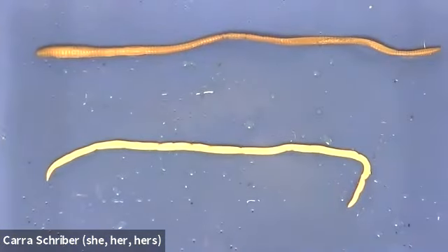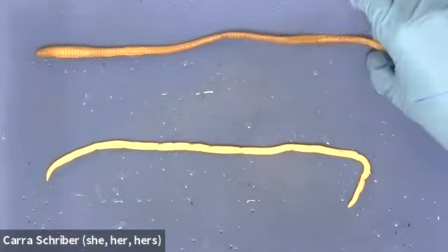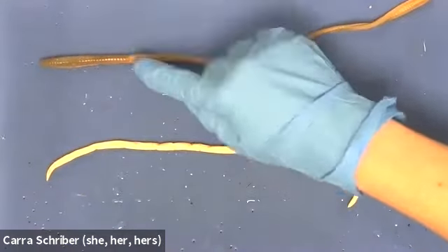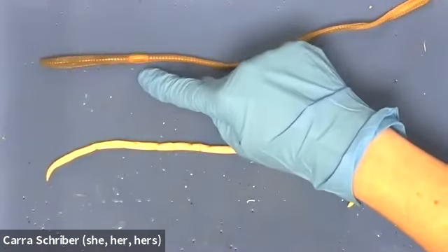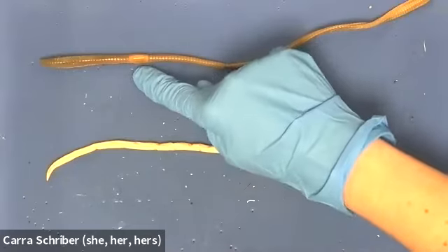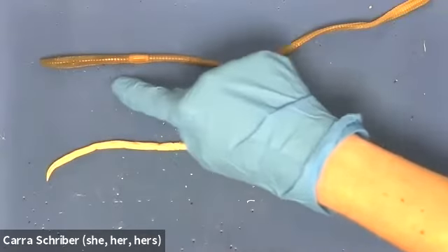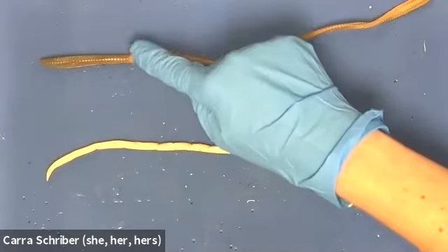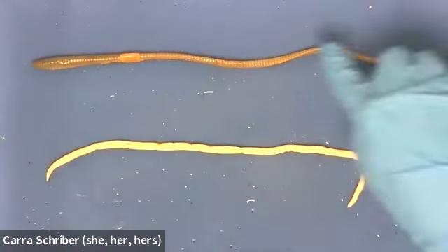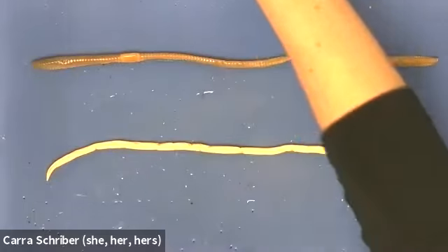We talked in the last video about earthworms and how we orient ourselves. With the earthworm, the first thing you want to do is find this kind of bulbous reproductive organ called the clitellum. This is always going to be towards the front end of the organism. Here we have it, and it's closer to this end than it is to that end, so we know that this is the head end.